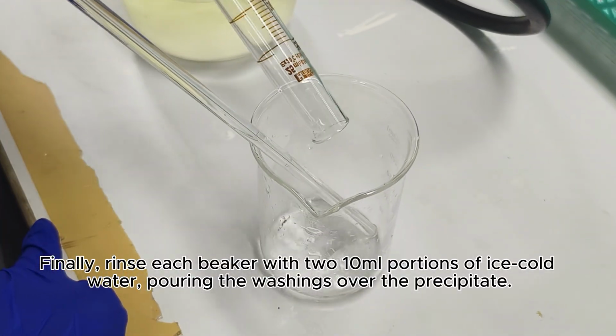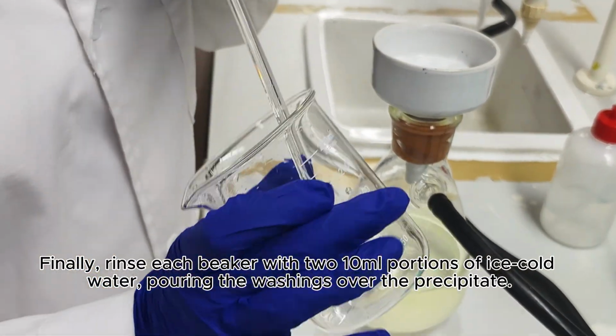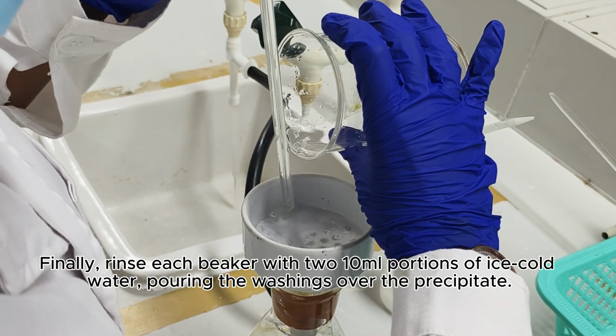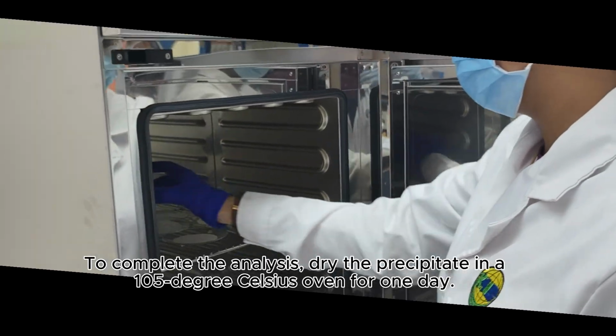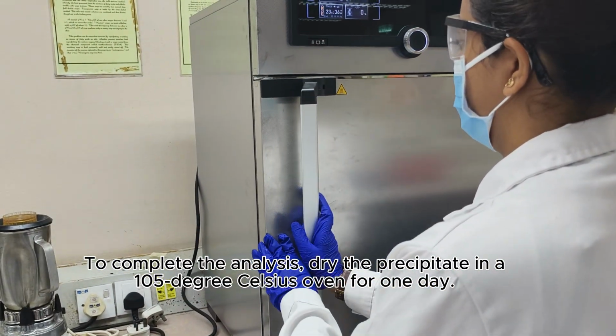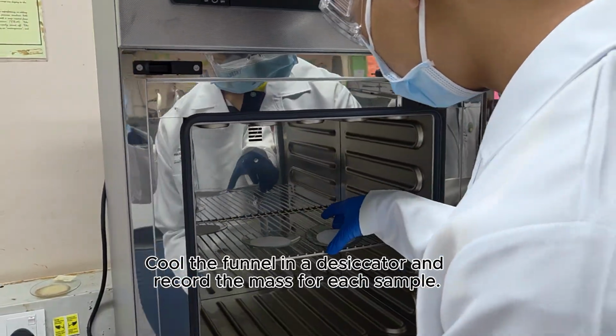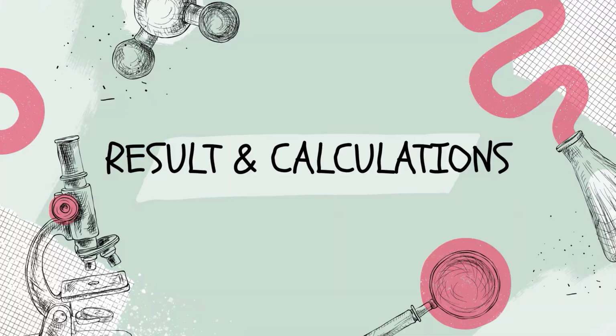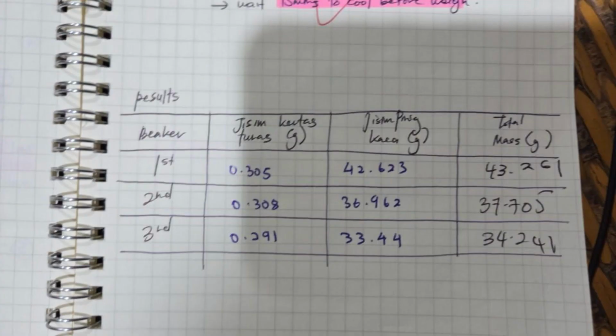Finally, rinse each beaker with 2 10 milliliter portions of ice-cold water, pouring the washings over the precipitate. Complete the analysis. Dry the precipitate in a 105 degrees Celsius oven for 1 day. Cool the funnel in the desiccator and record the mass for each sample. This is the raw data gained from the experiment. This data is then used to make the calculation.